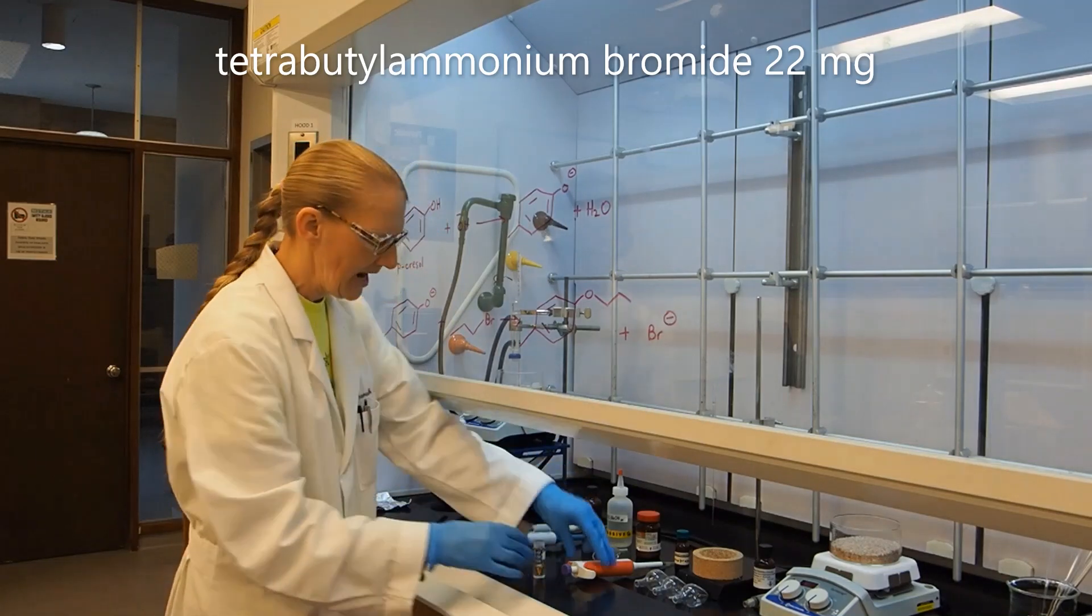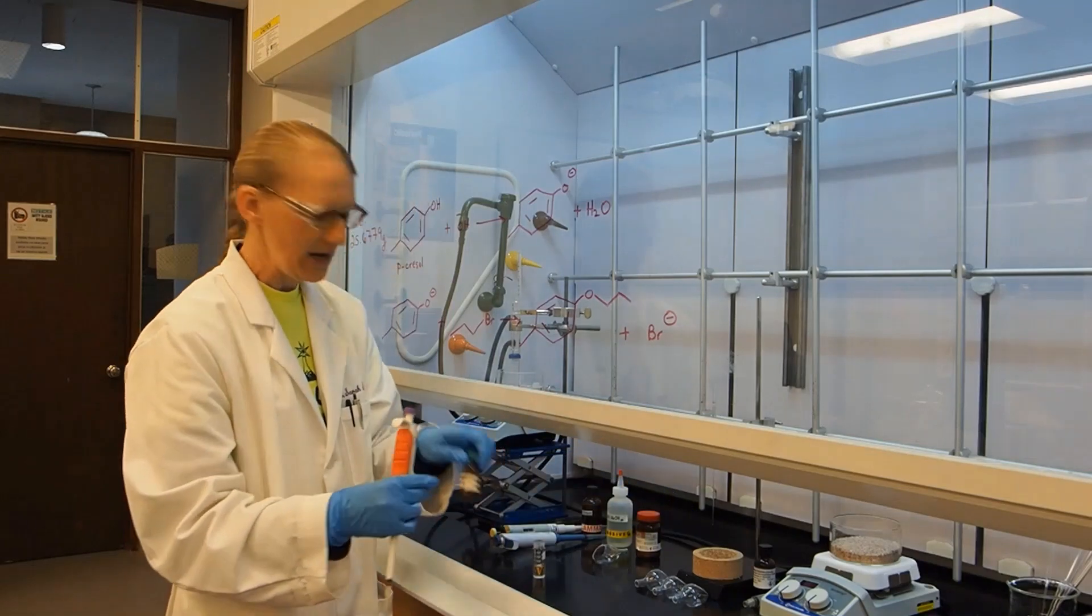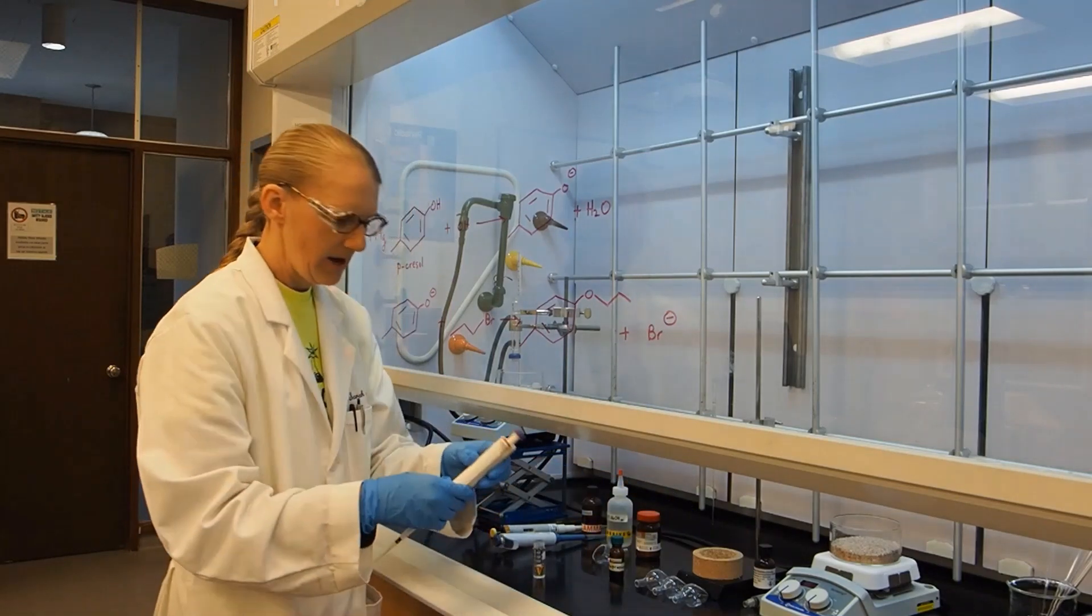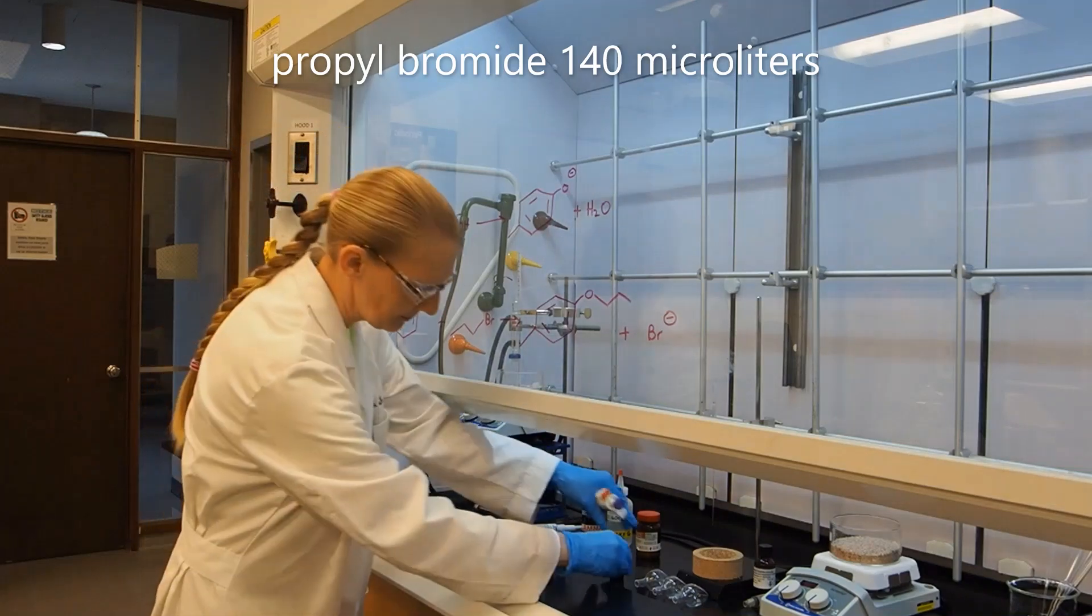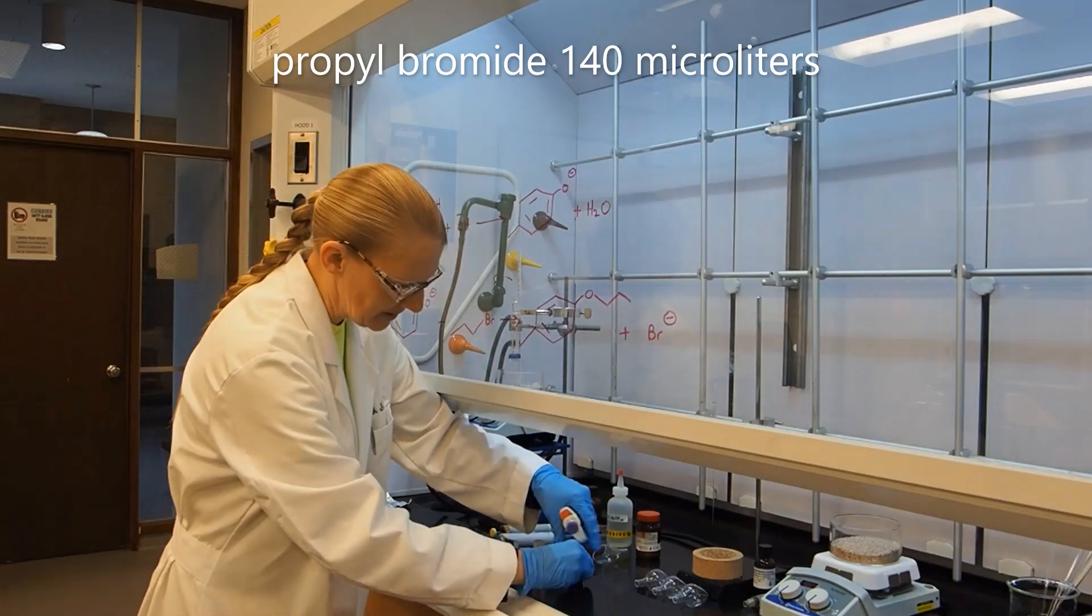The last reagent is the propyl bromide. I've already set my automatic pipette to 140 microliters, and I'm going to add that now.